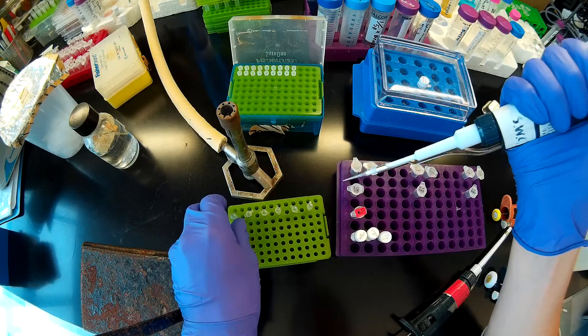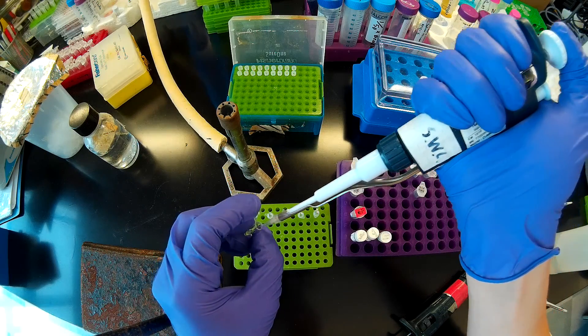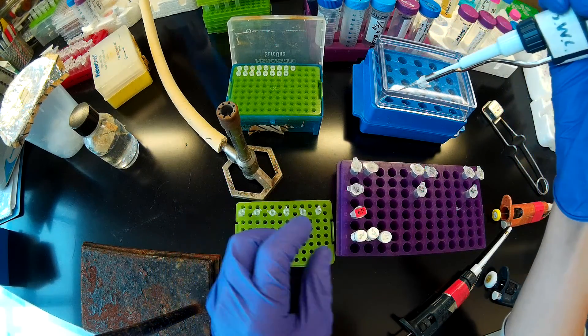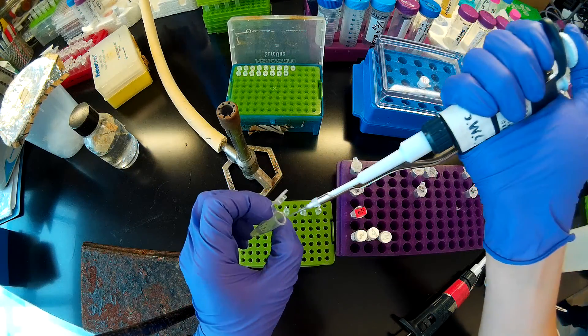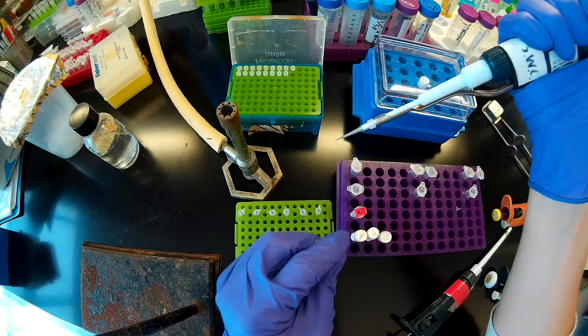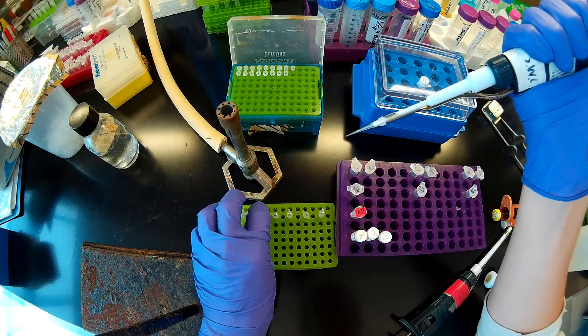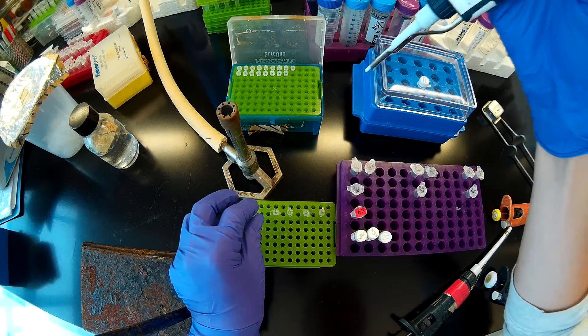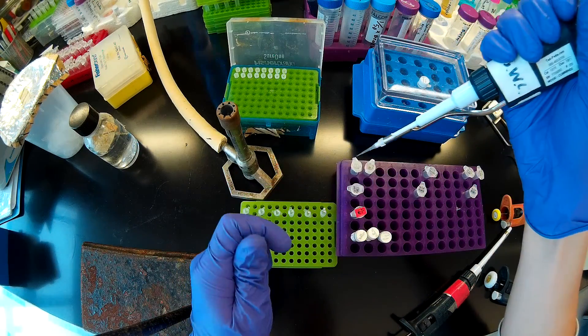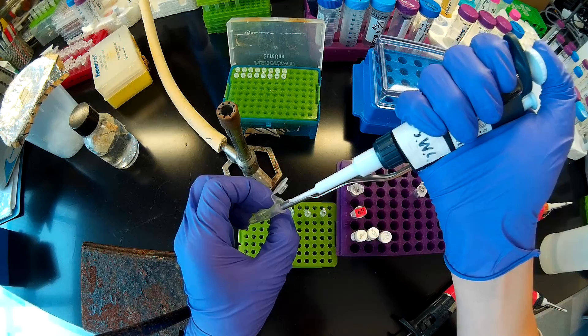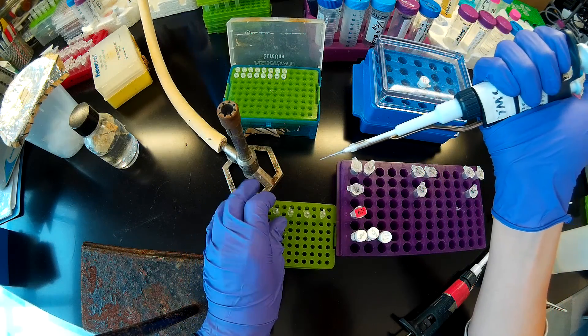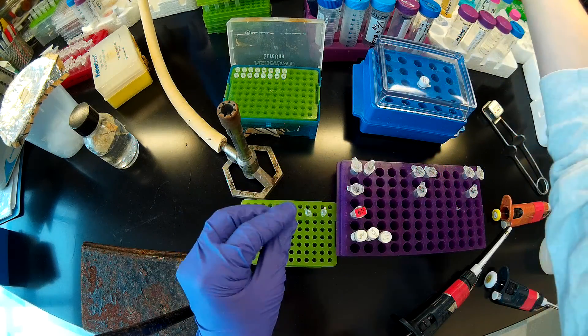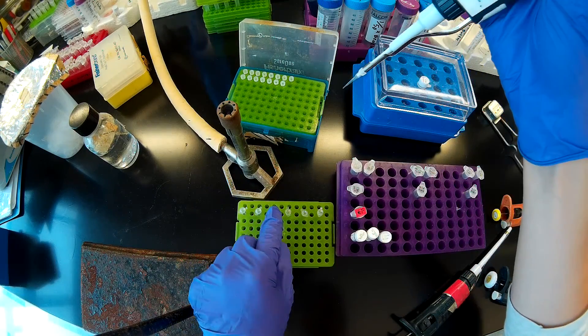I don't really think we have to worry about the reverse primer precipitating out when we freeze them, but just for posterity's sake, I'm going to go ahead and mix my primer before I add it to the reaction.